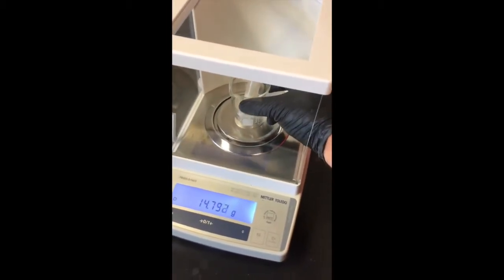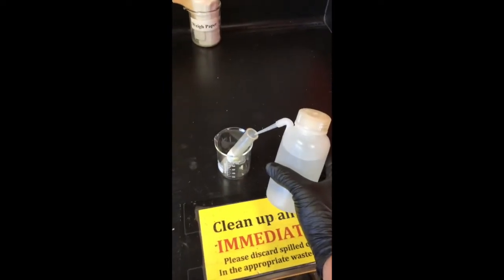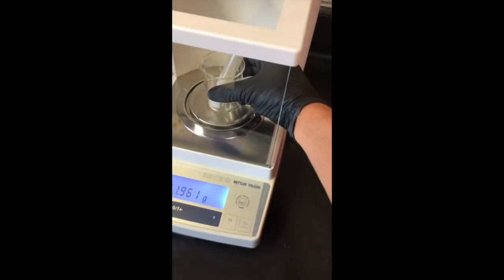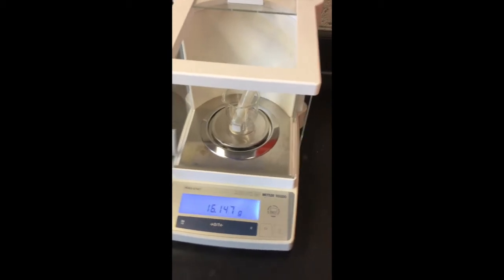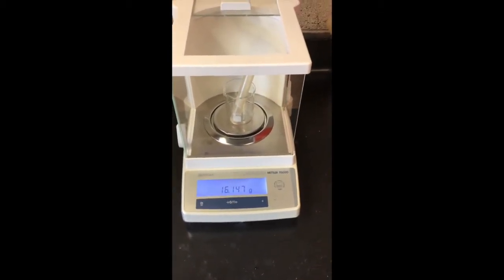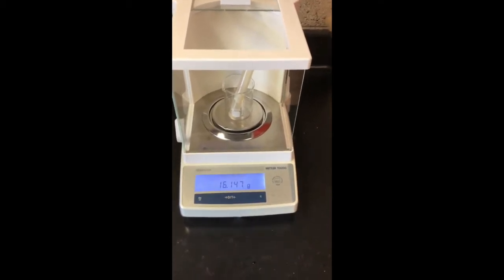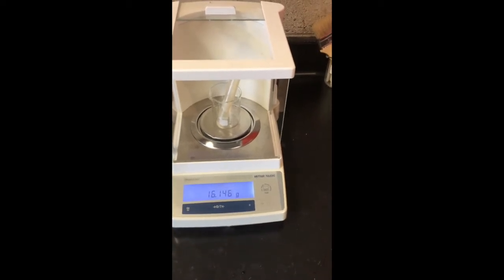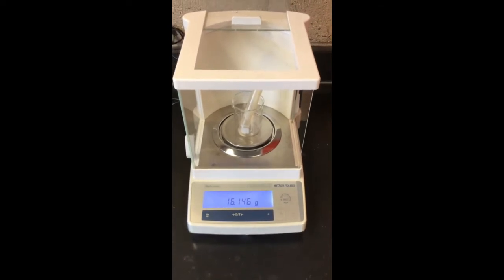Ooh, so close. And oh, way off. So basically, you get the idea. I'm going to go ahead and correct that, and then we'll be good to go on the centrifuge. Okay, this is 16. So that's about a mil of water too much. So I'm going to take a mil out approximately and get it down to 15.2-ish. And then I'll show you how to work the centrifuge.